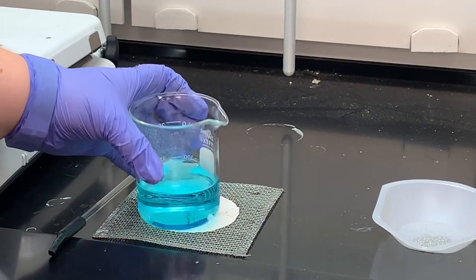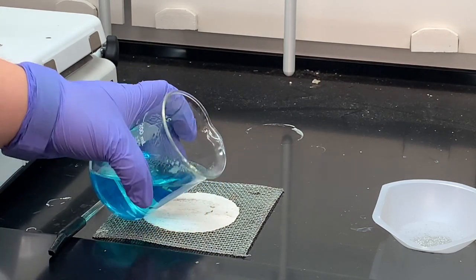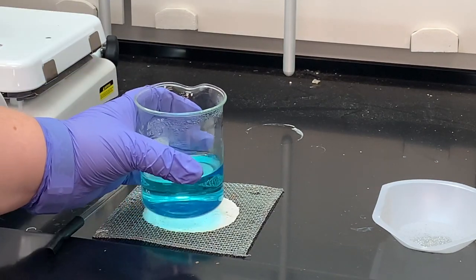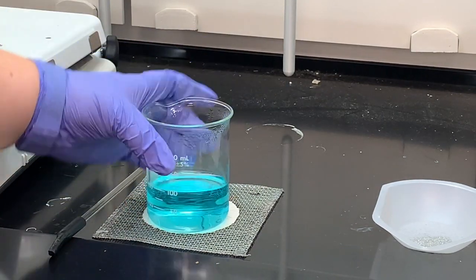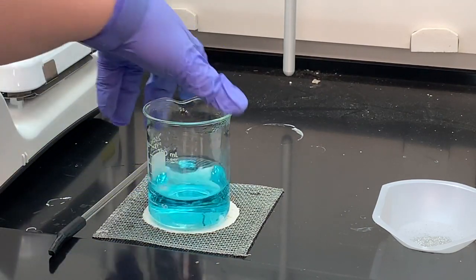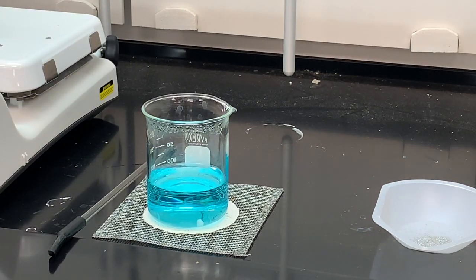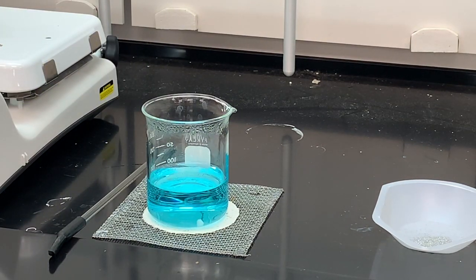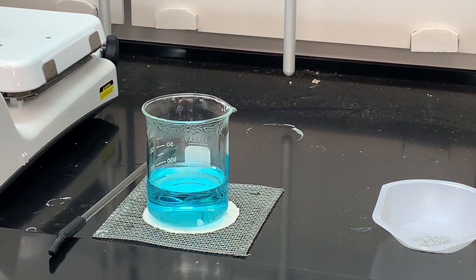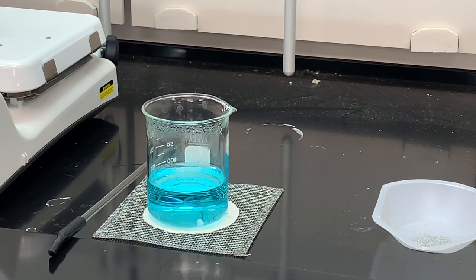I wouldn't worry too much about that. If you see some larger clumps, you can go ahead and rinse them in, but if you miss some, that's fine — you can account for some error in transfer, or it's just not reacting because it's stuck to the side of the beaker. Now we have another blue solution. It looks similar to the one we started with, but thinking about our reactants and the reactions in the procedure, you should know that this blue solution is copper sulfate.